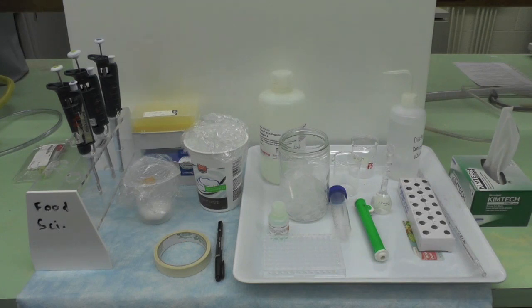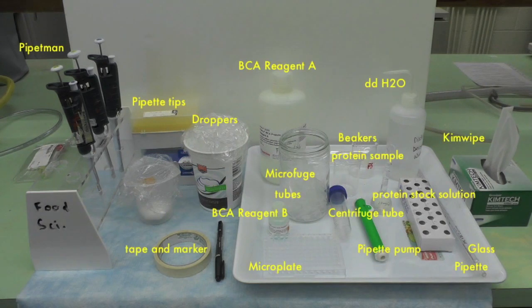This video will demonstrate how to perform a BCA protein assay. Here is the equipment you will need.